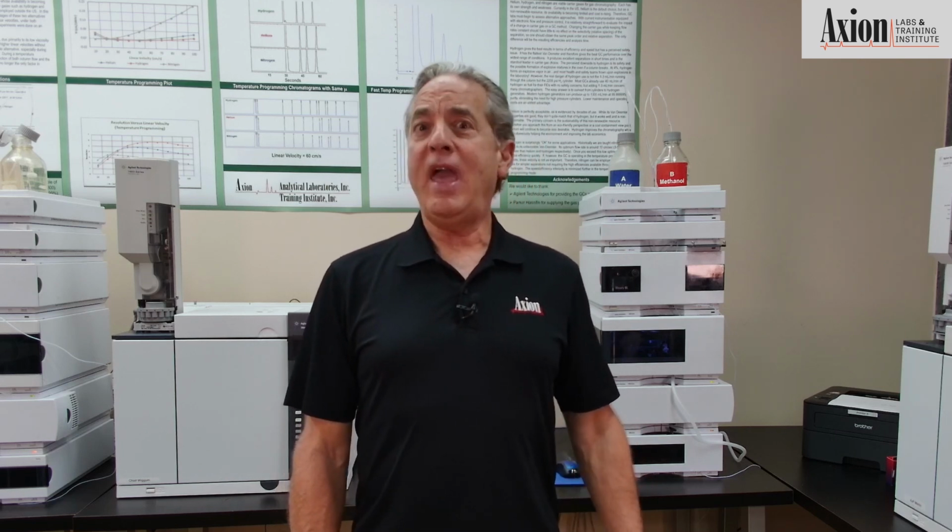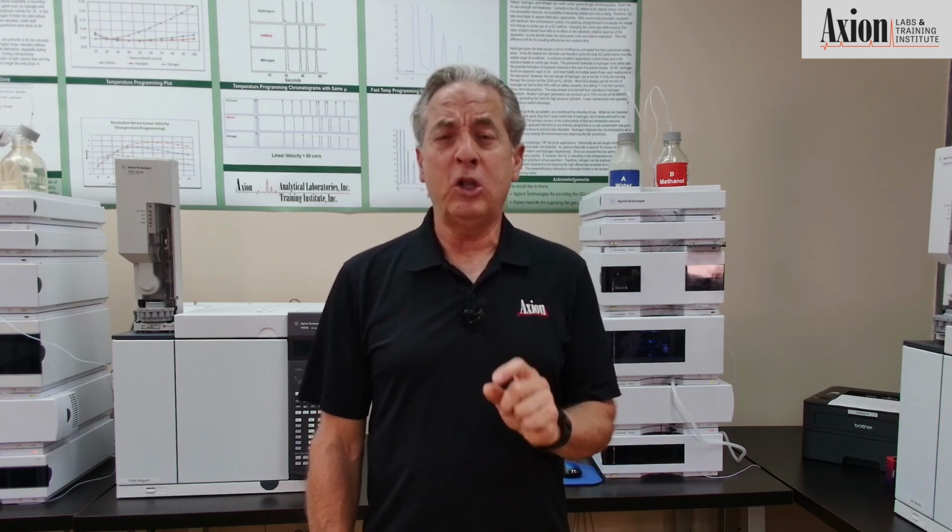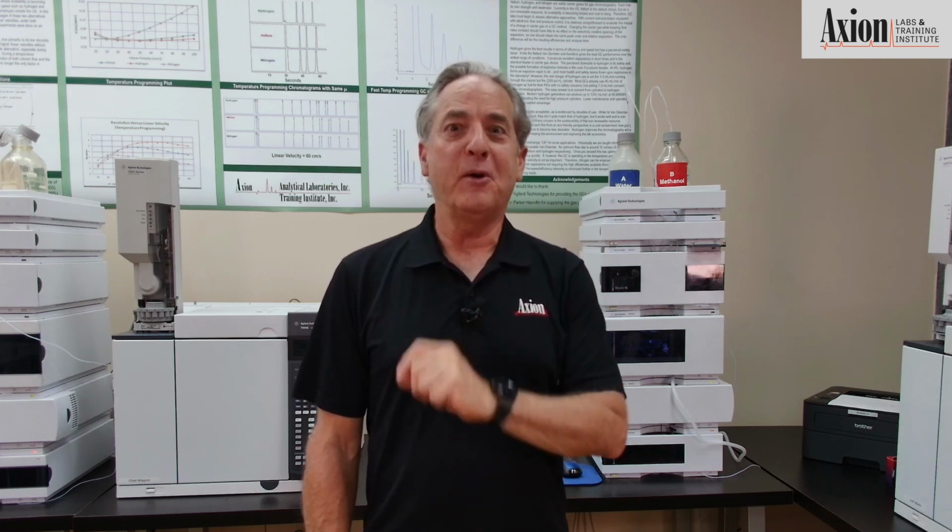If you get a negative peak anywhere in the middle of your chromatogram or at the end of your chromatogram when you're running a UV detector, that is an indication that usually you have a reference wavelength that's set at the wrong wavelength. So a little bit of an obscure issue, but on a UV detector, check back and I'll do a video on that one as well.